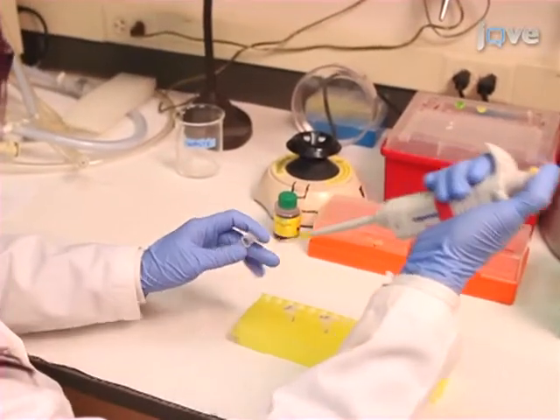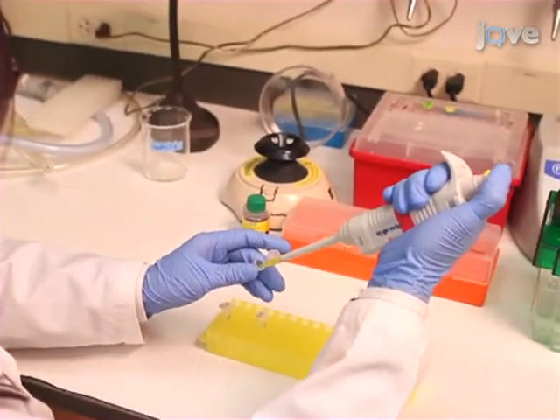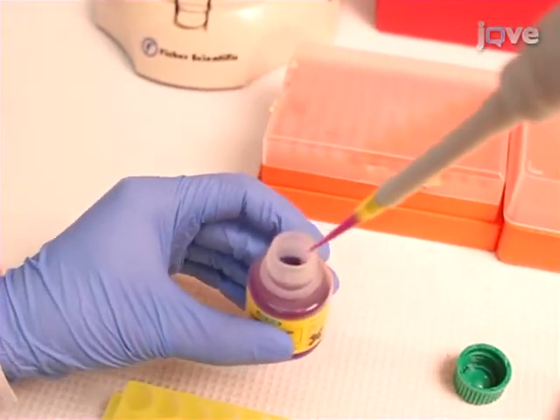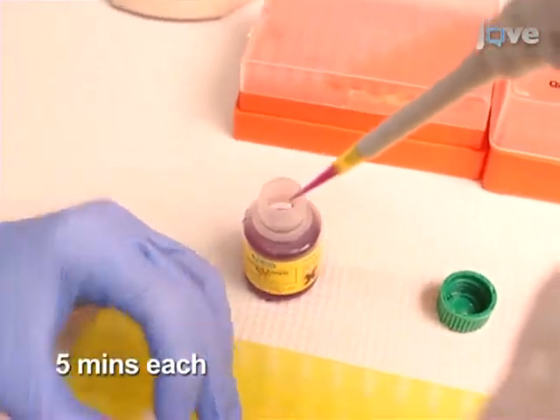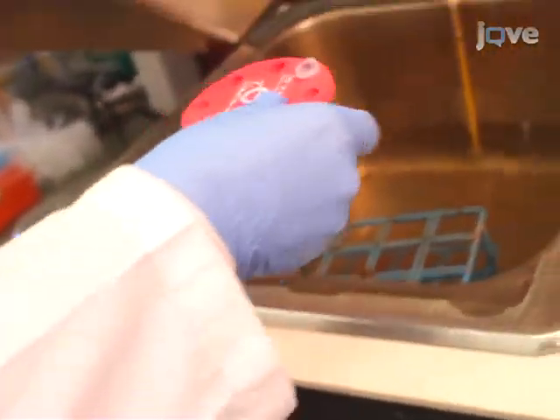Combine samples and add an equal volume of Laemmli sample buffer. Boil for 5 minutes and separate on a precast 12% polyacrylamide gel. After rinsing the gel 3 times with filtered water, stain with Coomassie blue for an hour and destain overnight in water.